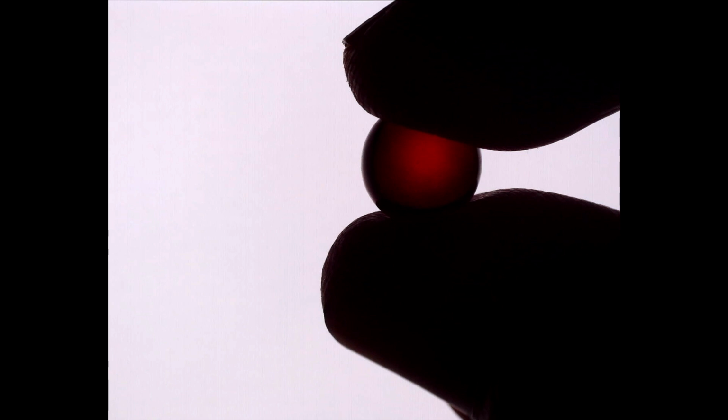Since we've seen some pleochroism, we know that we're not looking down the optic axis of our corundum sphere, and the easiest way to actually find that optic axis is going to be bringing in our upper polarizer and taking a look at our sphere with cross polarizers. And here, as we reorient our sphere, we can see our uniaxial optic axis interference figure.